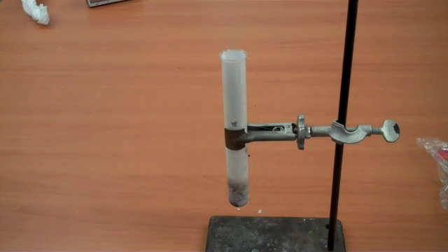All right, so that happened pretty fast. You can see how much heat, how much energy is released when oxygen gets to attack sugars and other various simple carbohydrates.